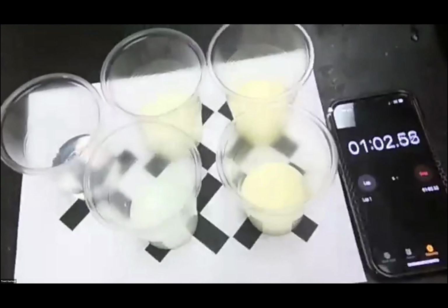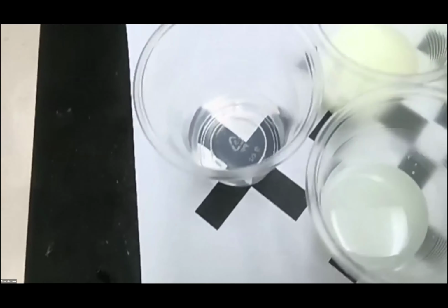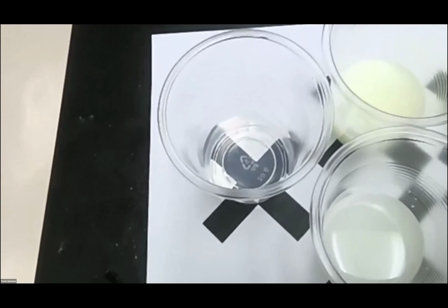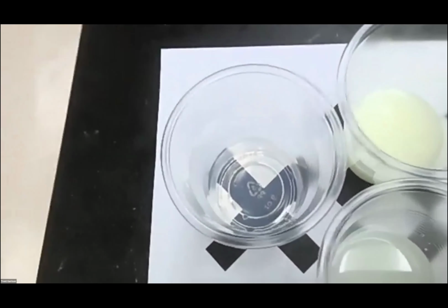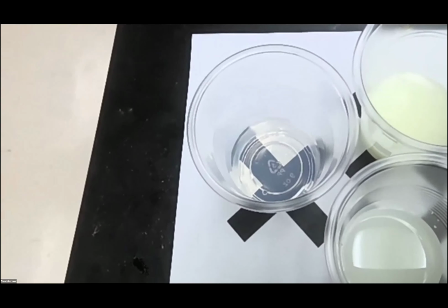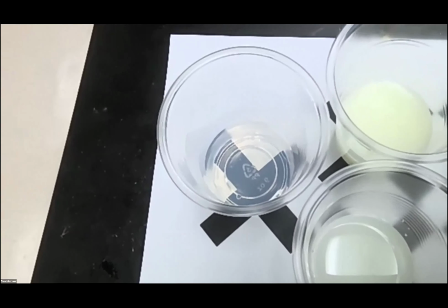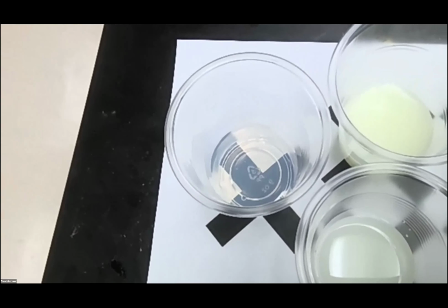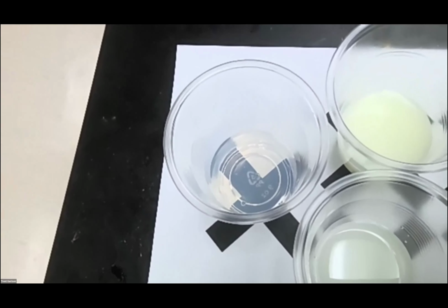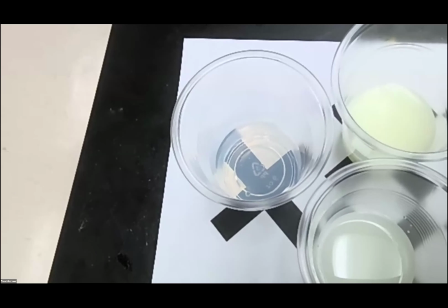Okay, we are at 1 minute on the timer for this final one. And even at this, man, it is super, super slow. So we're already equivalent to what was the last one. And it is taking a while. It is now starting to show the reaction. So we're going to count this until it's completely obscured. And then we can get our final data point that we can make a nice rate of reaction graph. First order rate of reaction graph.